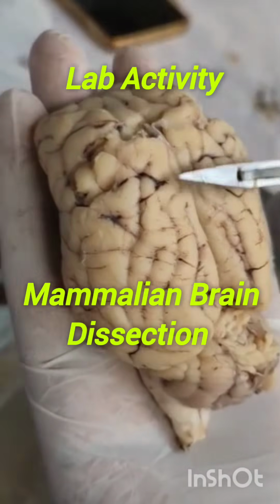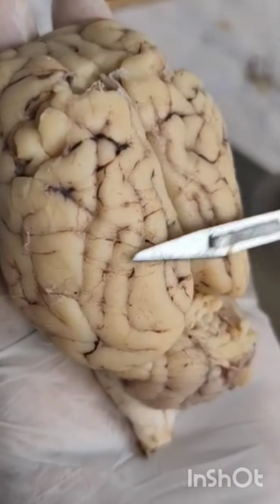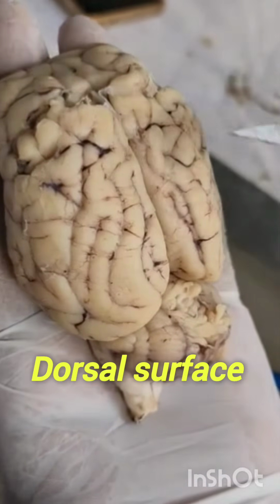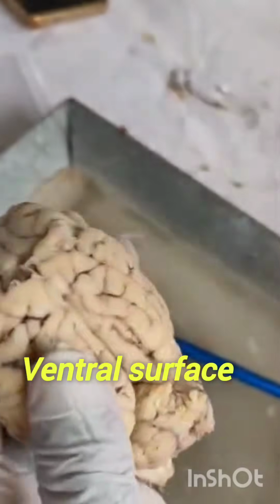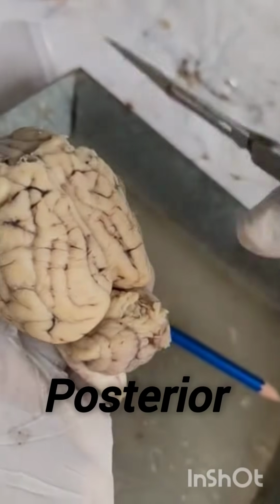This was the mammalian brain. I am going to demonstrate the external and internal structure of the brain. So this is the bulged portion. This bulged portion is called the dorsal surface, and the flattened surface is called the ventral surface. This is the anterior portion, and this is the posterior portion of the brain.